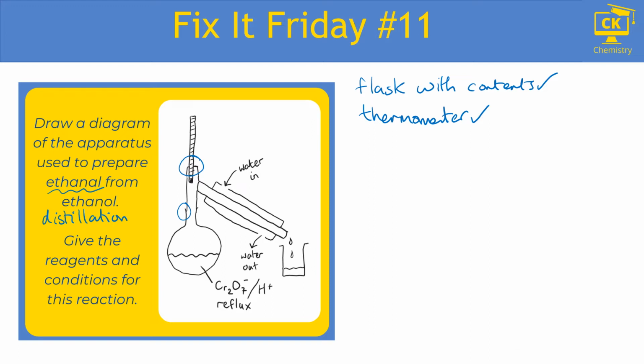Well, one of the first problems is, although we have no gaps in our apparatus, so the gas isn't going to escape, it also cannot enter the condenser because we've got these two parts where we've sealed off the ends. So the ends of the condenser, the gas can't actually go through, can't condense, and can't go into liquids. Remember that our diagrams are always cross-sectional, so we should not have any gaps where things can get out from the sides, but we also need to make sure that the gas can flow all the way through to the collection container at the end.